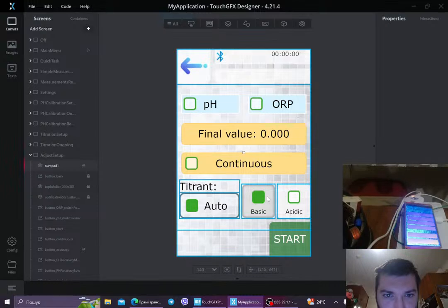So the idea is that we select pH, he specifies the value to which he wants to go. Let's say this pH 9, and then the device starts to add the titrant. Okay, I don't know how to pronounce this word. And of course, the pH is gonna increase. It goes up because of the titrant, let's say we took sodium hydroxide, and at some point we reach the final value and we have to stop. But once we stopped, there was a fault in the logic of the program. So let's show it again.